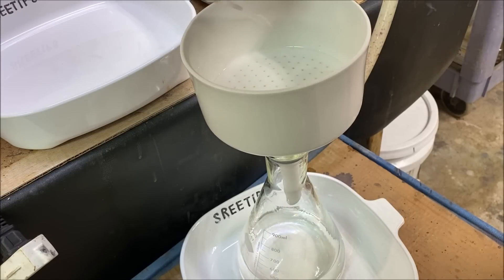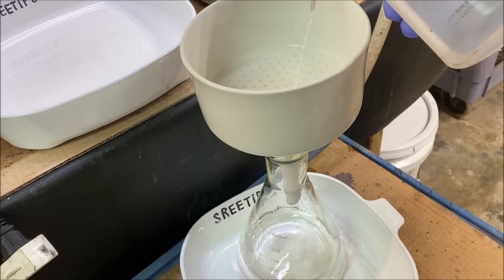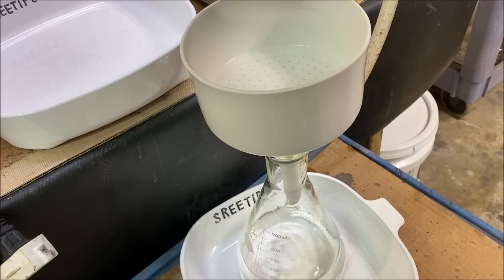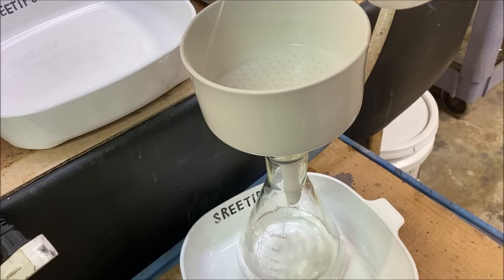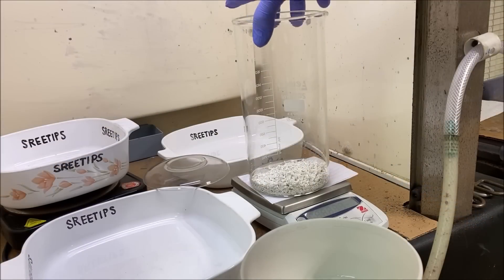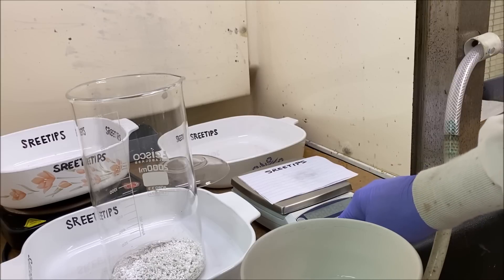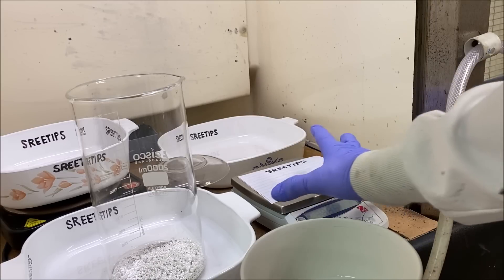Now I've got that silver nitrate pulled through this filter. We'll just rinse it out real good with some distilled water. Here's our 620 grams of silver plus there's a little bit left in there from the previous dissolve.